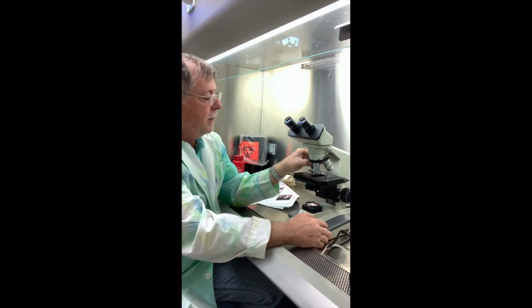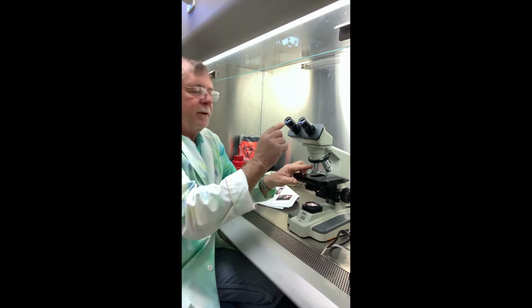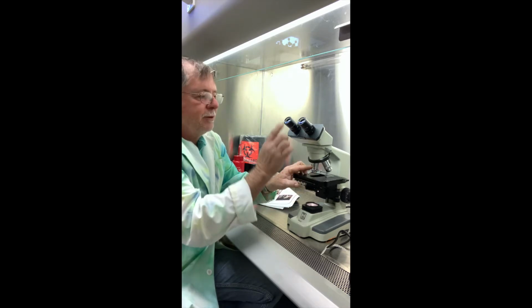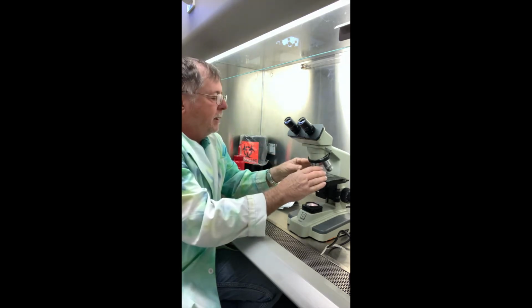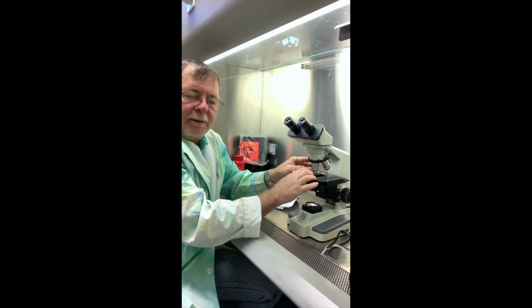Okay, so they stand for the magnification power. So this 4 one will magnify it 4 times. Coupled with the ocular of 10 times, we multiply those together to get the total magnification. So this is going to be 40 times magnification: 10 for the ocular, 4 for the objective. So that's 40 power, we call it. That means it magnifies the image, makes it look 40 times bigger than it is. Then we go to 10, that's 10 times a 10, which is 100 power.